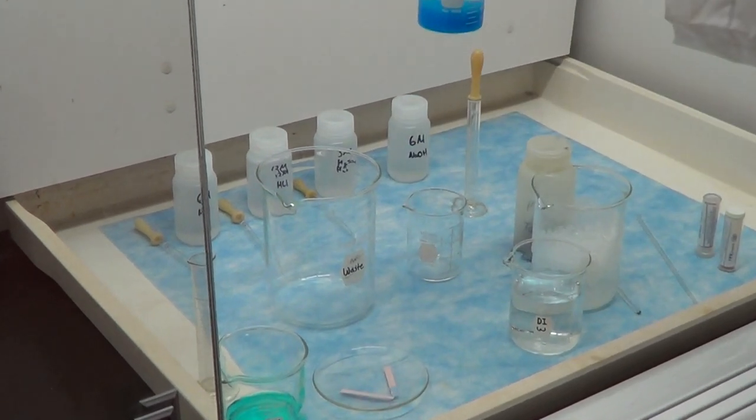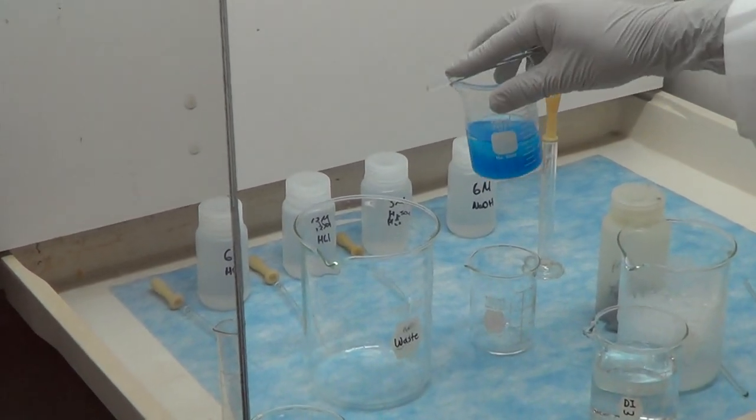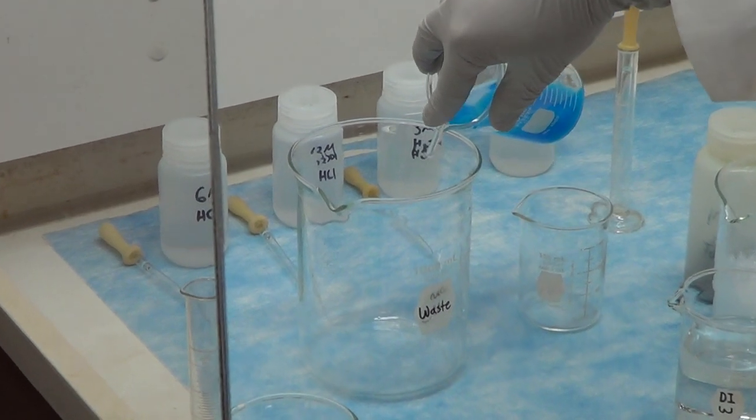Once the precipitate settles, we will decant the major part of the clear colorless supernatant liquid into a waste beaker.